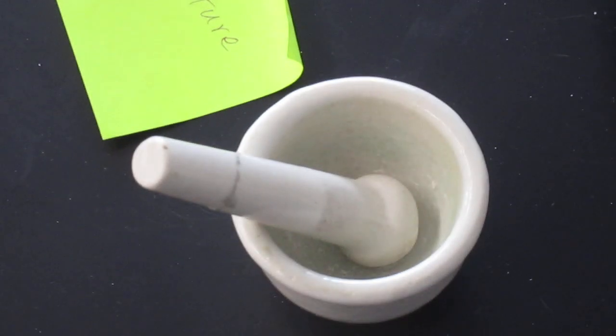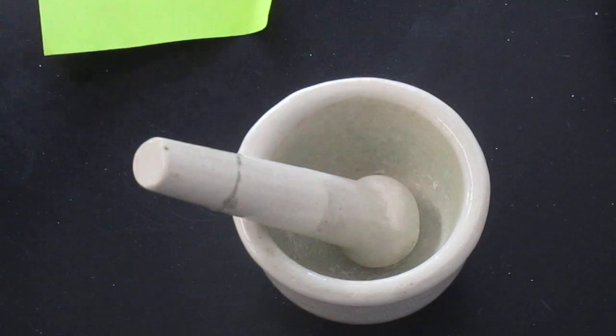The next step is the texture test. So, Ionic 1.